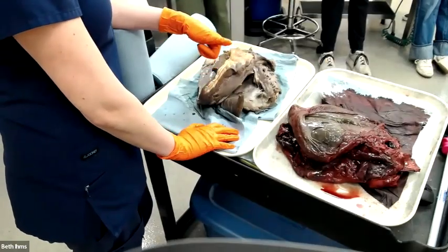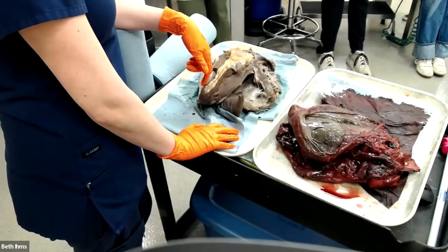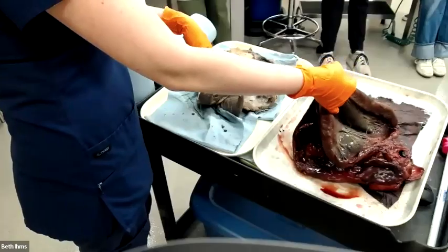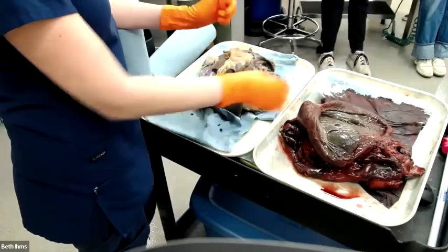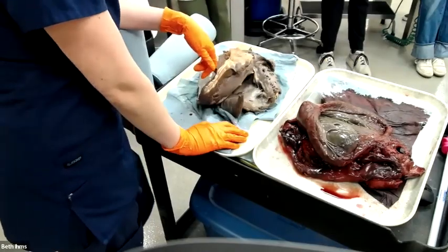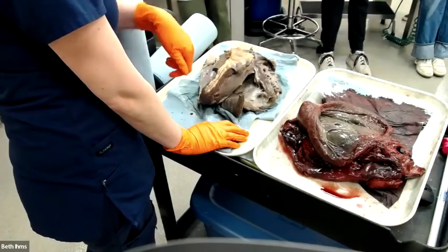Is there anything abnormal with that part? Which one? Point out the fresh one. This was just a disposal. This animal came in because it had a penetrating shoulder wound that was pretty deep and they euthanized it because of that. All of its internal organs were normal. It only had the one bot fly. No colic or anything. Very unusual for a horse.